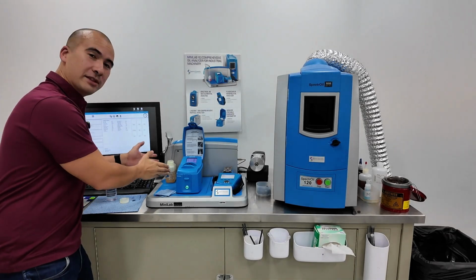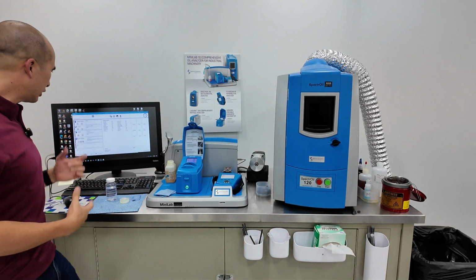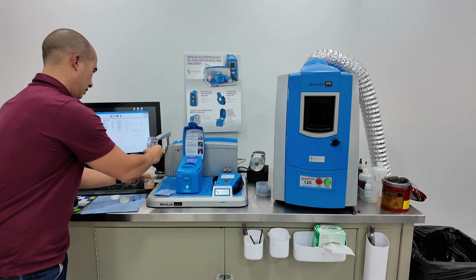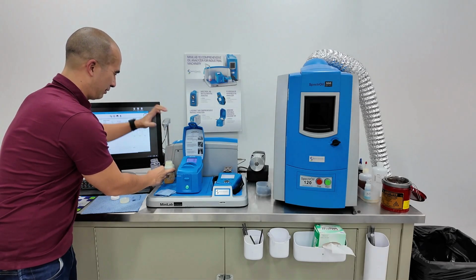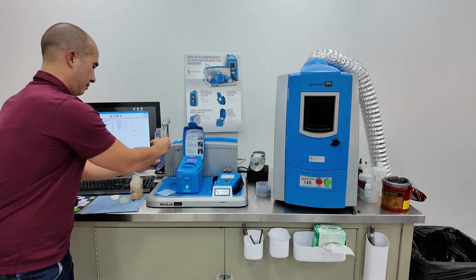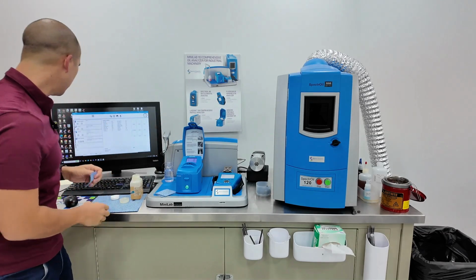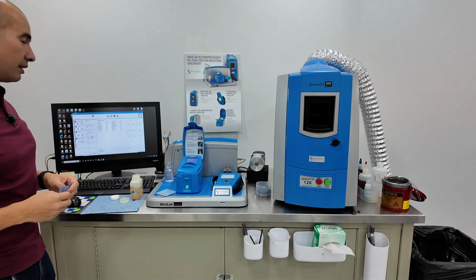All right, so now our sample for LaserNet Fines is done. And per the instructions, I've got to start the flushing cycle. It makes sense, right? We need to clean the thing out. So I've used this, and I haven't done that very well, because the easier way is actually just to raise this. Okay, we're putting the sipper tube down. And then continue.